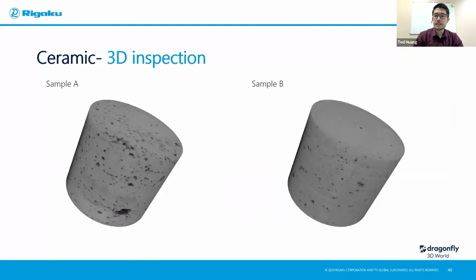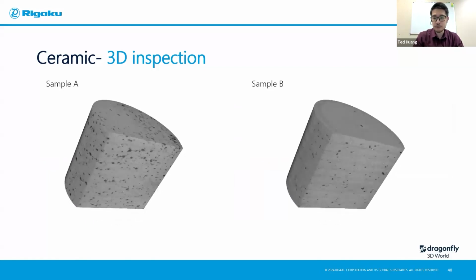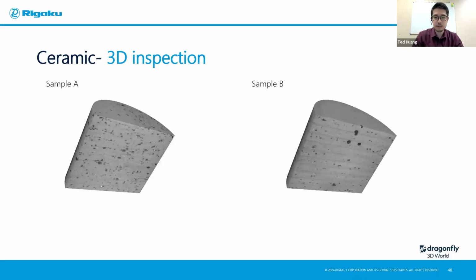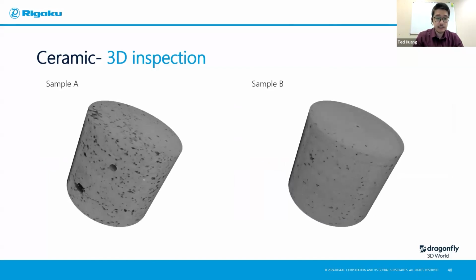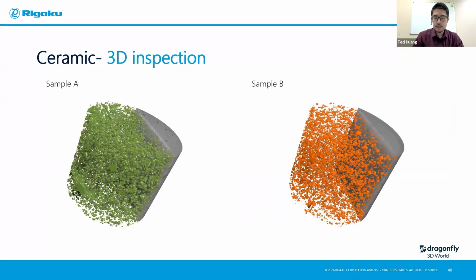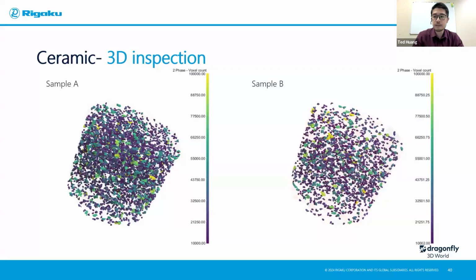And so here are 3D comparisons side by side for sample A and sample B, with the slide-through view in the 3D to give you some connection back to the 2D image we just saw earlier. And also doing segmentation, highlighting those secondary phases to showcase how they distribute. And in some cases, in this case, you'll be like, oh, that looks like a lot. This visually doesn't tell me a lot of things, but you have full control. So we can definitely do some filtering saying, hey, I'm just interested in the feature size in this range.